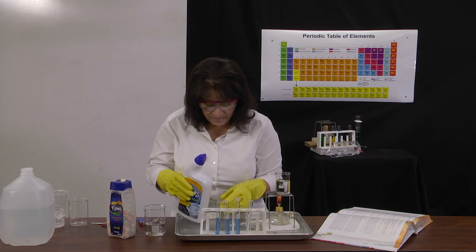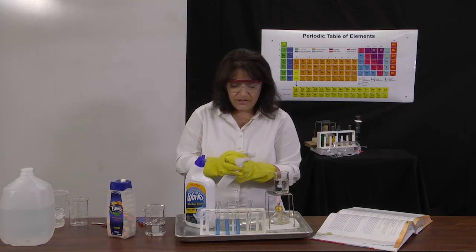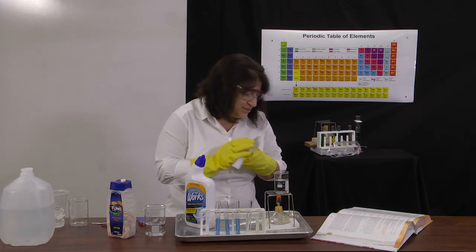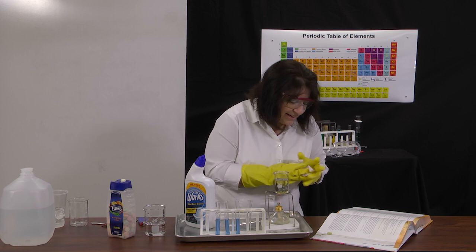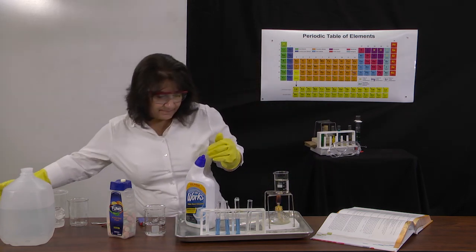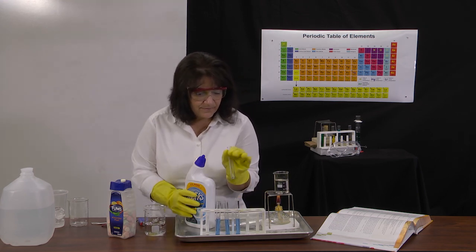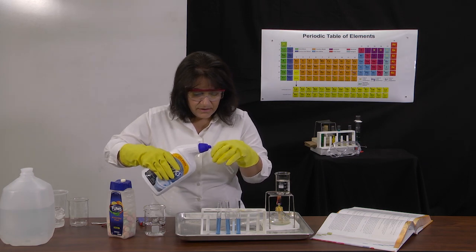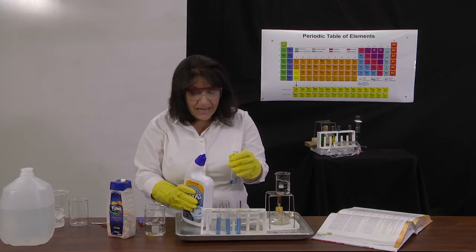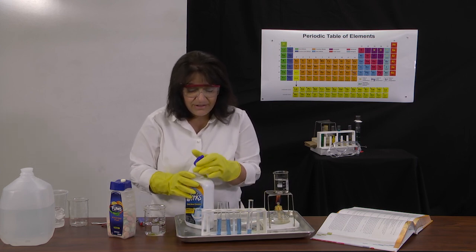All right, kind of bubbly. I'm going to use a paper towel and just get the fluid off. The 4th test tube, we're only going to add about 1/8 full of our toilet bowl cleaner and then dilute that with water. So I only want this about 1/8 filled. And when I say about, I mean about. It doesn't have to be exact, but we do want it less than the others.